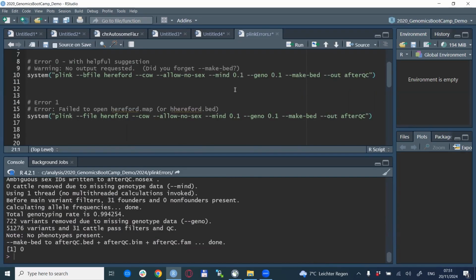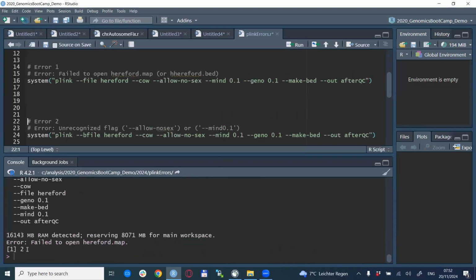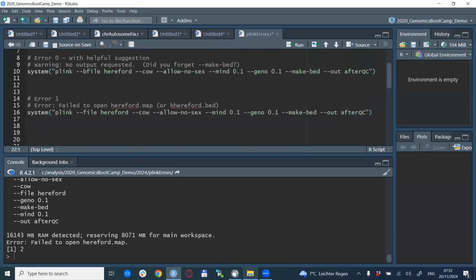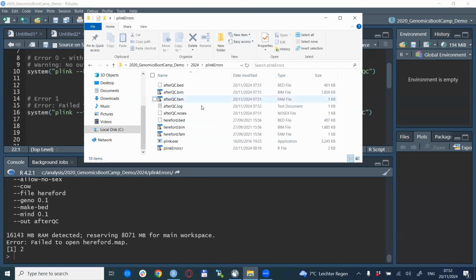The second error that is, I think, very, very common is the so-called failed to open file error. This happens when you either do not have the file in the directory where PLINK is looking for it, which is normally the working directory, or you have it in a different format. So let's see this example. This is a normal PLINK line, and we try to run it. When we do so, we get this error message: error, failed to open Hereford.map. This actually means that the Hereford map file is not where it should be.